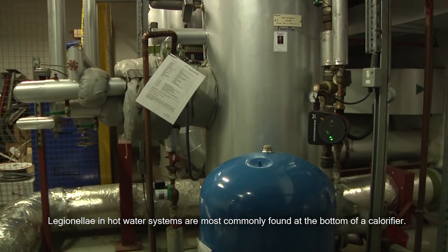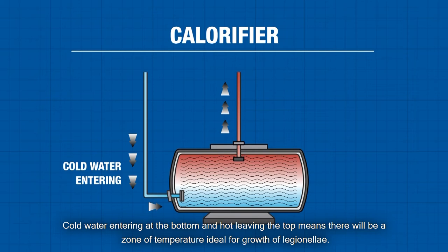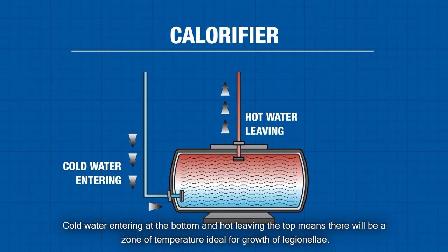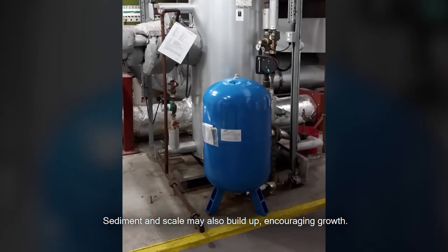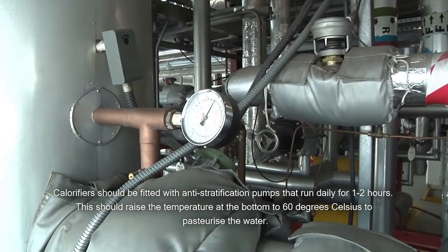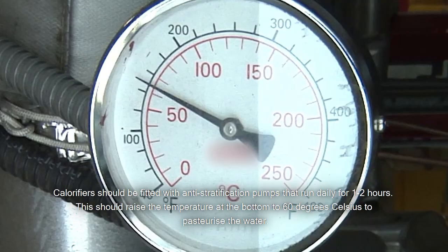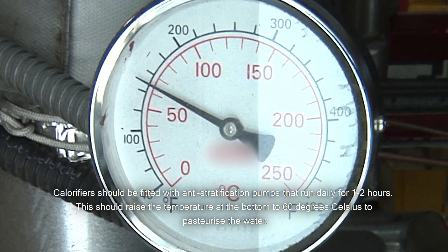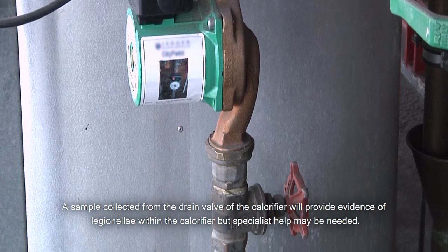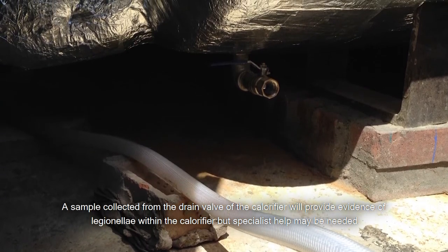Legionella in hot water systems are most commonly found at the bottom of a calorifier. Cold water entering at the bottom and hot leaving the top means there will be a zone of temperature ideal for growth of Legionella. Sediment and scale may also build up, encouraging growth. Calorifiers should be fitted with anti-stratification pumps that run daily for one to two hours. This should raise the temperature at the bottom to 60 degrees Celsius to pasteurise the water. A sample collected from the drain valve of the calorifier will provide evidence of Legionella within the calorifier, but specialist help may be needed.